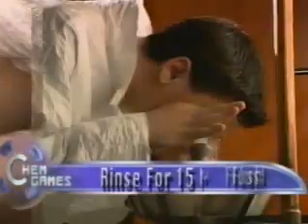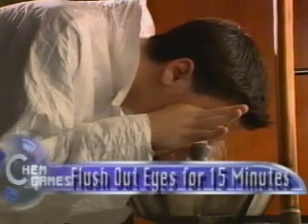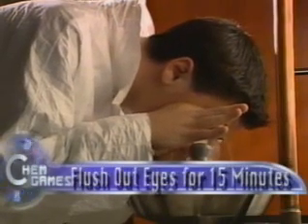And if they got something in their eyes, they should flush them out for 15 minutes at the eye washing station. The thing about washing the eyes is you have to hold the eyelids open. Otherwise, the chemical might stay under the eyelid.